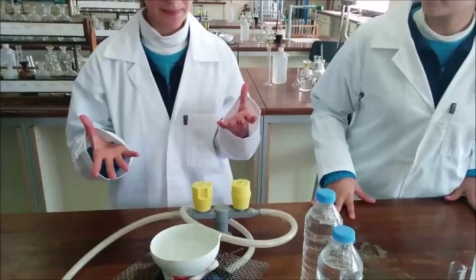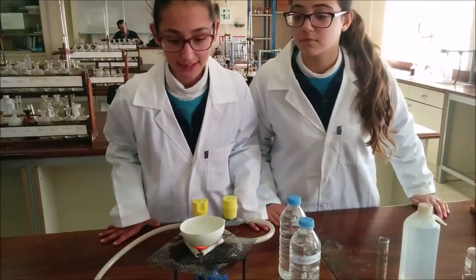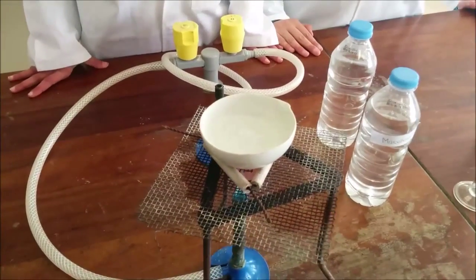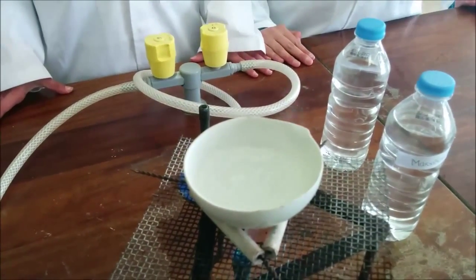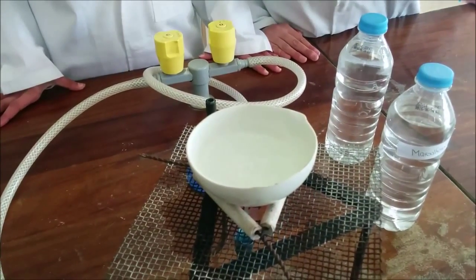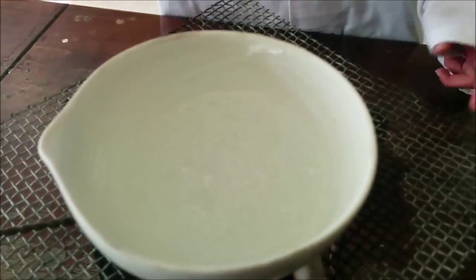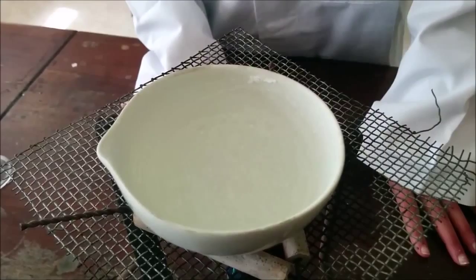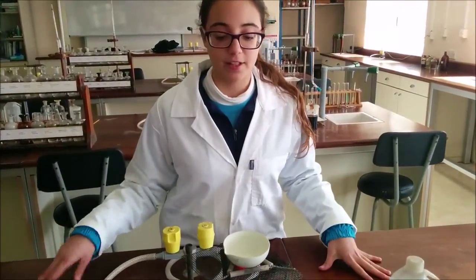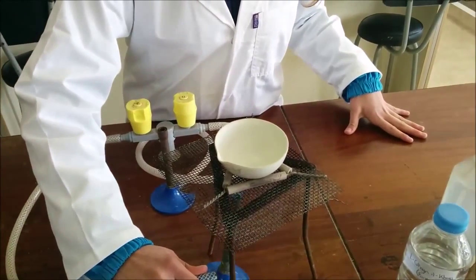As you can see, the water vapor and the solids are starting to form over time. The solids have not fully formed yet, but bubbles are starting to form. As time went by, white salt crystals started to form, and as boiling occurs, more salt crystals and other solids form. When salt crystals are about to form, we pull the Bunsen burner in and out to prevent the basin from cracking.